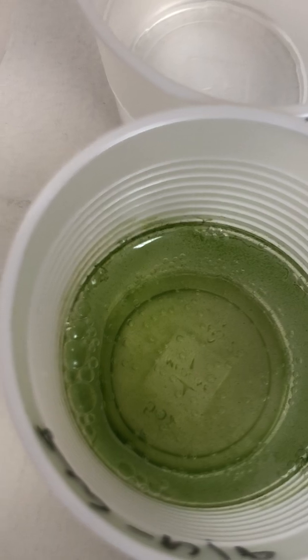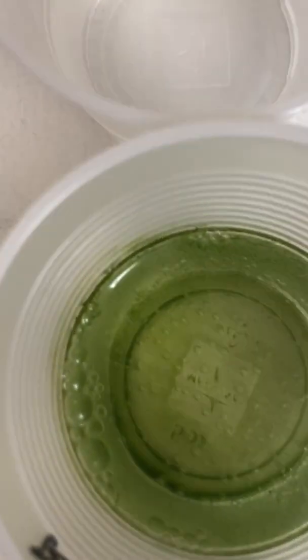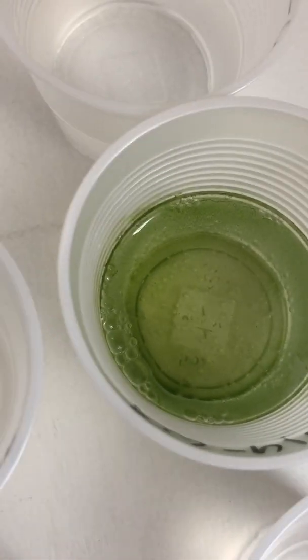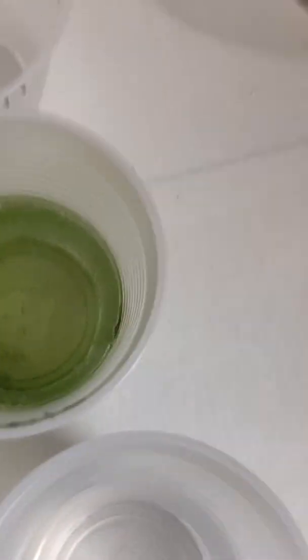You can see the green in there, and a little bit of bubbles, because they're live organisms undergoing cellular respiration. The green might also be undergoing photosynthesis, because it was on my windowsill where it was getting light. When we talk about this qualitative analysis, we would say there's definitely some cause from the combination of nitrates and phosphates, because the control has nothing to compare it to.